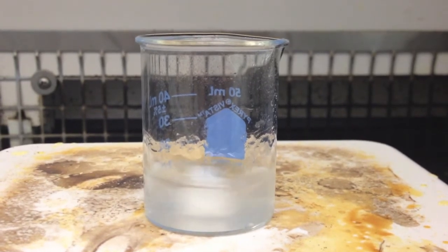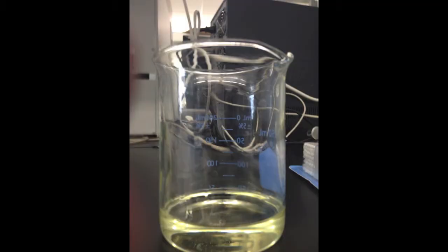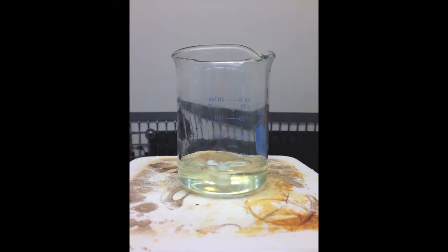At this point, sodium methoxide has formed. Proceed cautiously. Sodium methoxide is a strong base. Next, pour 50 ml of your oil into a 250 ml beaker. Use a magnetic stirring hot plate to warm it to 50 degrees Celsius while stirring at medium speed. Once the oil has reached 50 degrees, turn off the heat.